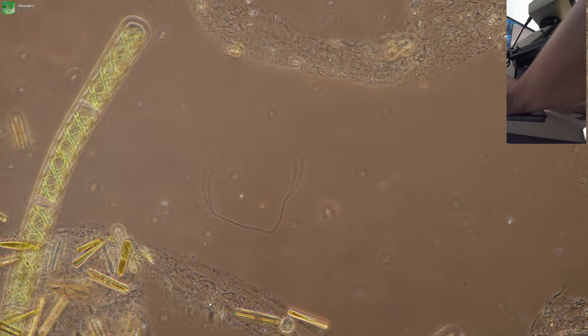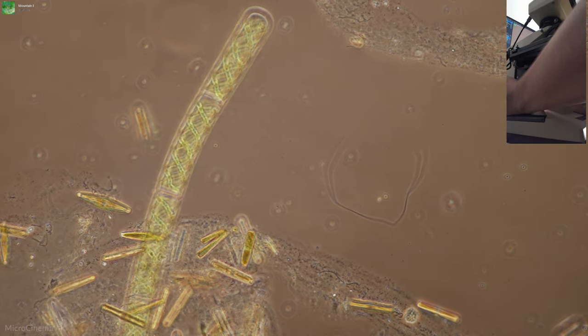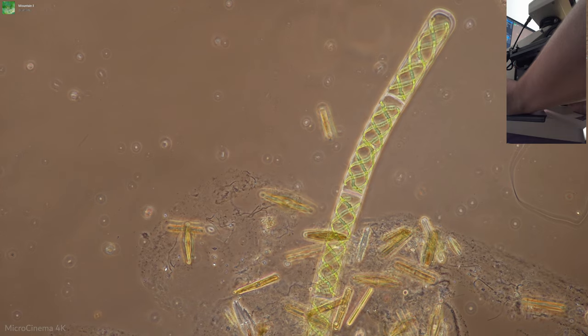And we'll just touch up exposure a little bit. I'm at ISO 2000 right now. And you can see we've got a lovely phase contrast effect.